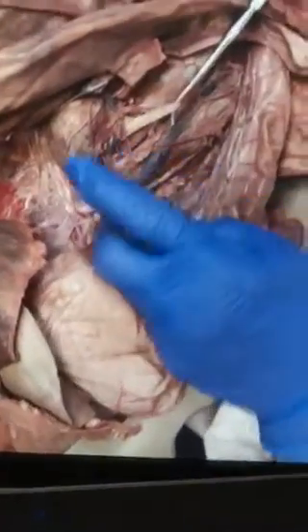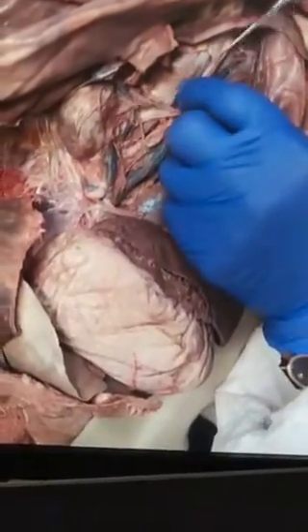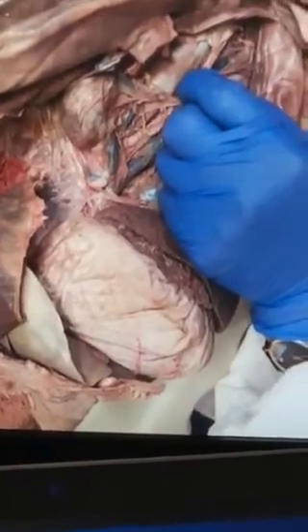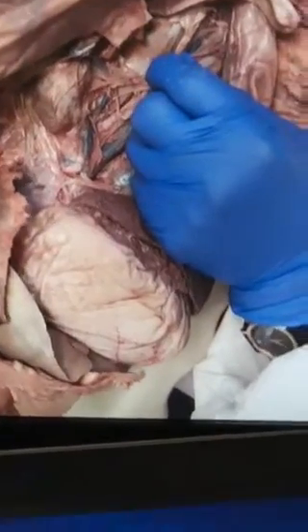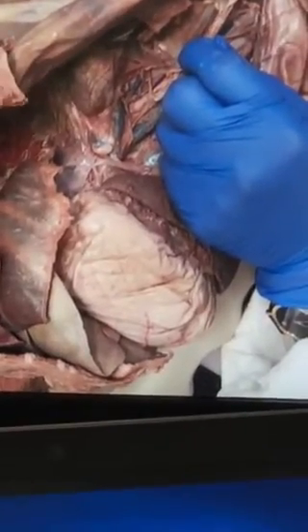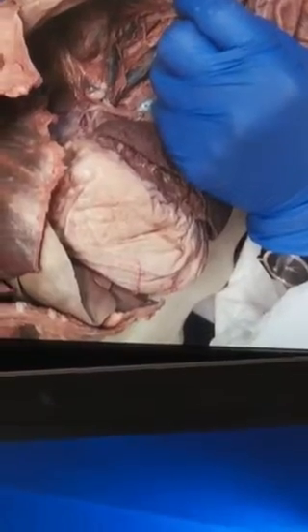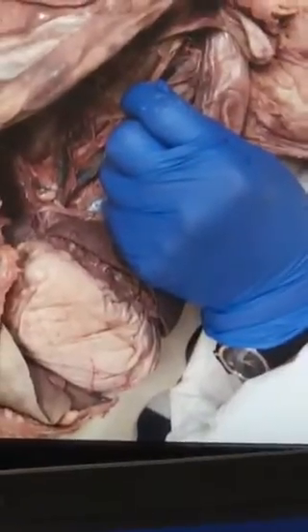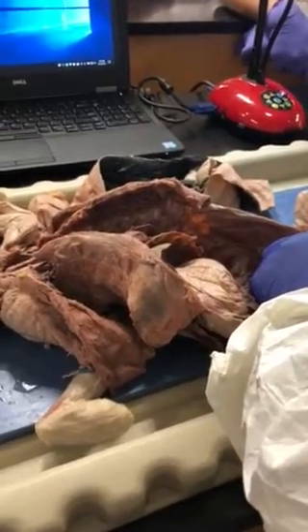With the structure of the kidney, that will be asked from the specimen and also from the model — and also the heart. There should be no problem identifying parts of the heart. The superior vena cava goes into the right atrium. The hole in the right atrium is the coronary sinus. The flap on the right side is the tricuspid valve. The thread-like structure is the chordae tendineae, and at the end connected to the wall of the ventricle is the papillary muscle. The folded structures in the ventricle are called trabeculae carneae.